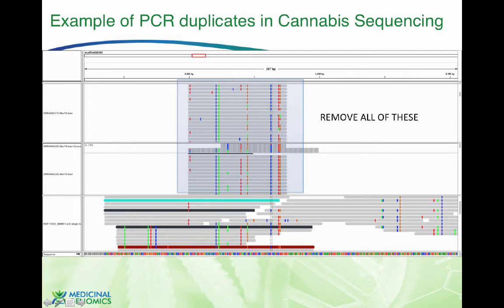So we have random start points on DNA molecules that cover this area. They have reads over here that are 150 base pairs long, so they're much better to map than these tiny 75 mers. And another 150 base pair read over here. And all of the read is actually genomic DNA, as opposed to here we have half of the DNA sequence is synthetic, which you have to throw out. And as a result, they're making homozygous calls when the data is clearly heterozygous. And so this has this sample misgenotyped.